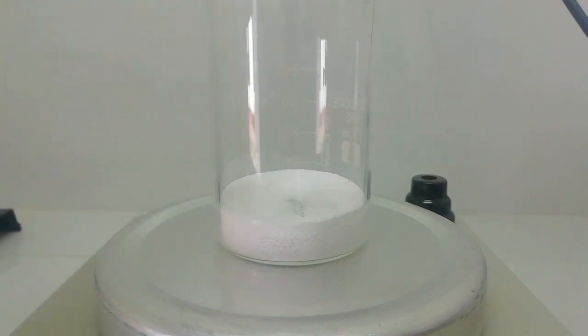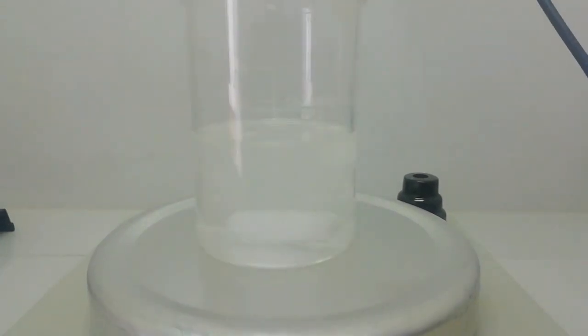Now I am going to dissolve this sodium carbonate in minimum amount of water. Okay, now the sodium carbonate solution is ready. Now I am going to bubble sulfur dioxide gas through this solution.